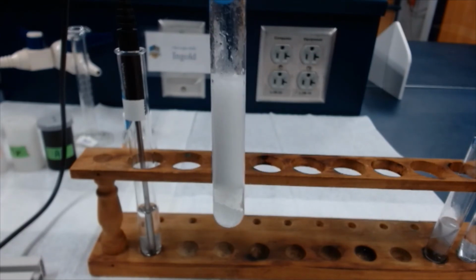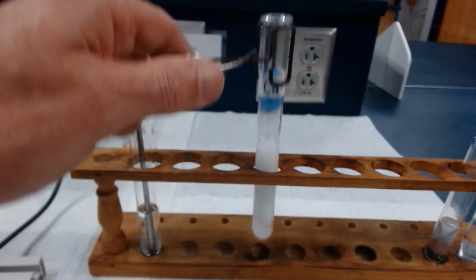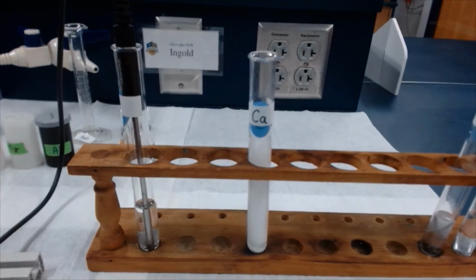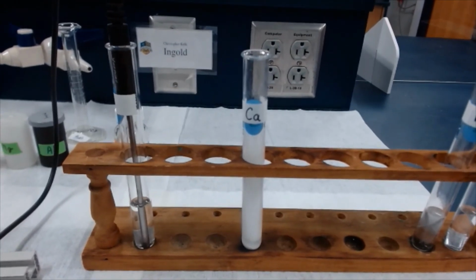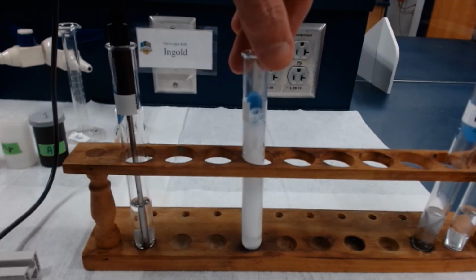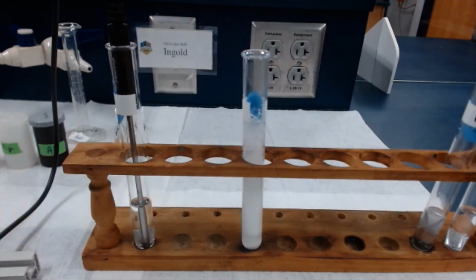All right, excellent. We'll keep watching it for another 30 seconds or so, and then we'll pause it, and I'll come back with the temperature. Holy Moses, it looks like the bubbles are climbing all the way up near the top of the test tube there. Holy smokes. Literally holy smokes. I can see some condensation coming out the top. All right, that was a good one.